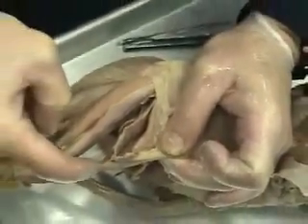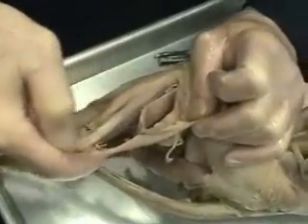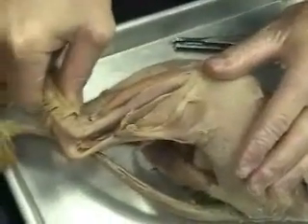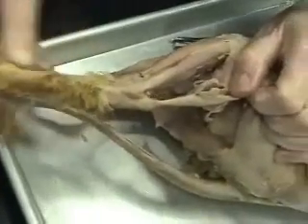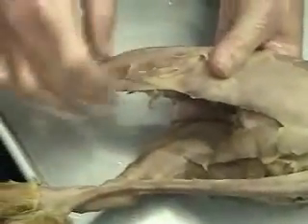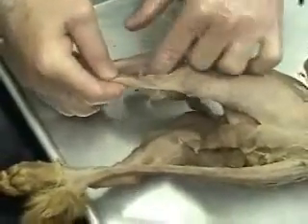On the back side, we have this huge gastrocnemius muscle — the superficial calf muscle — and right underneath it, a thin soleus muscle. Both the gastrocnemius and soleus insert via the Achilles tendon, named after Achilles, onto the calcaneus, or heel bone. That plantar flexes the foot, meaning it pulls the heel up so you're standing on your toes. You can also see here just another view of that gastrocnemius muscle.